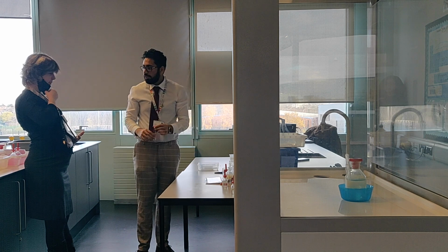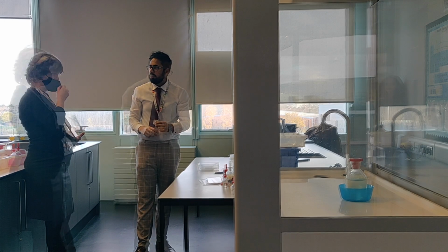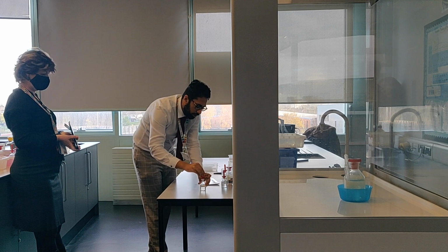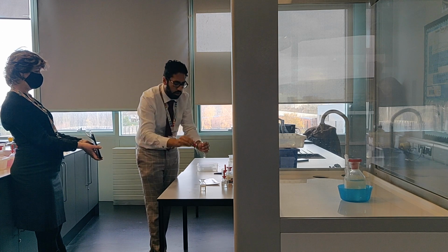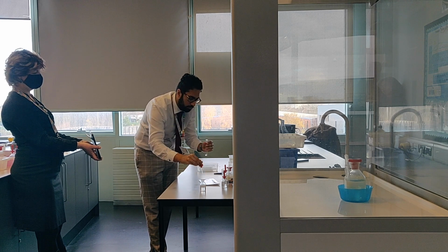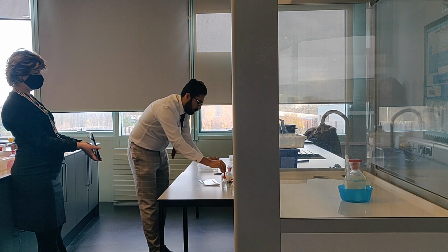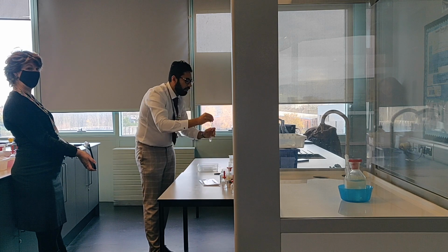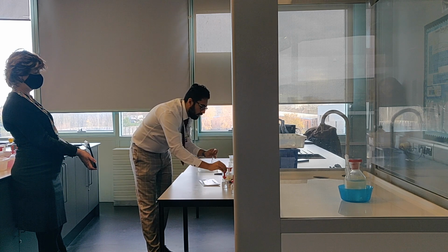We're going to do potassium bromide and potassium iodide. So, 10 drops. 1, 2, 3, 4, 5, 6, 7, 8, 9, 10. Okay. Right, then we're going to add nitric acid, dilute nitric acid as well. Okay, 5 drops. 1, 2, 3, 4, 5. Then our silver nitrate.